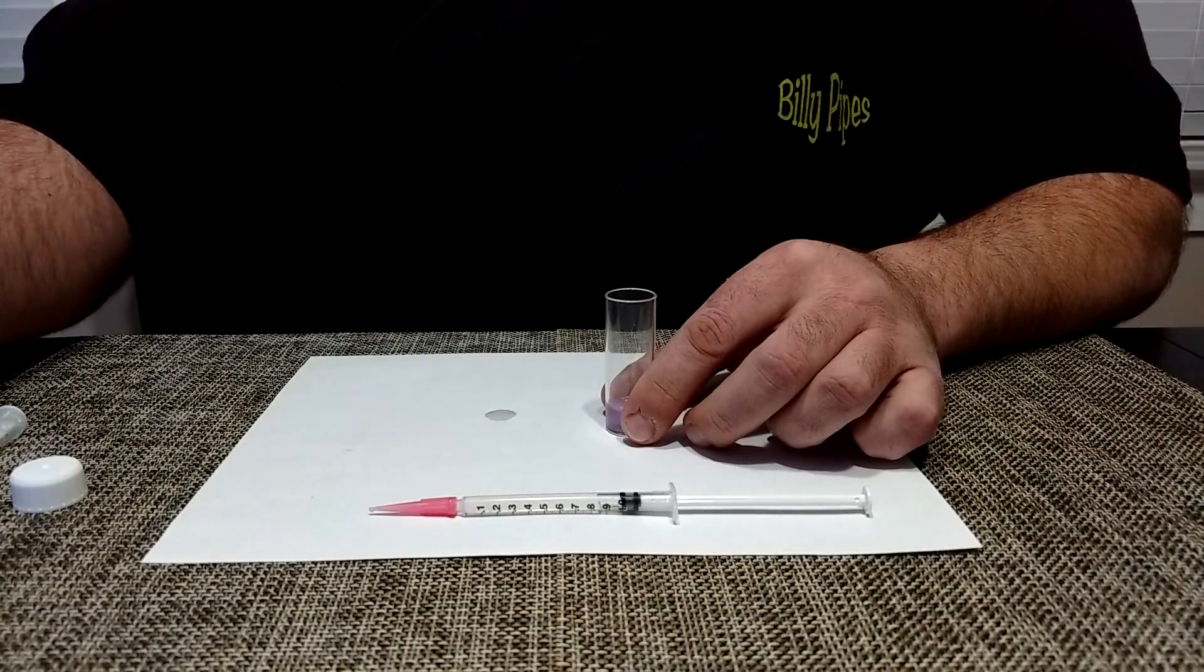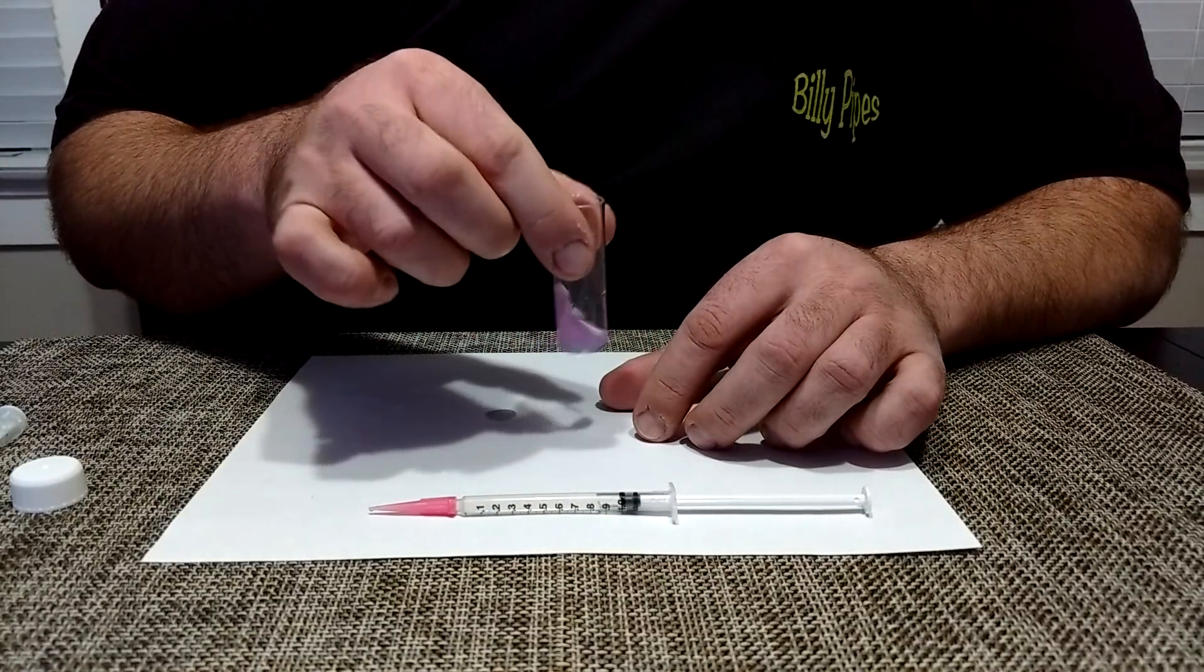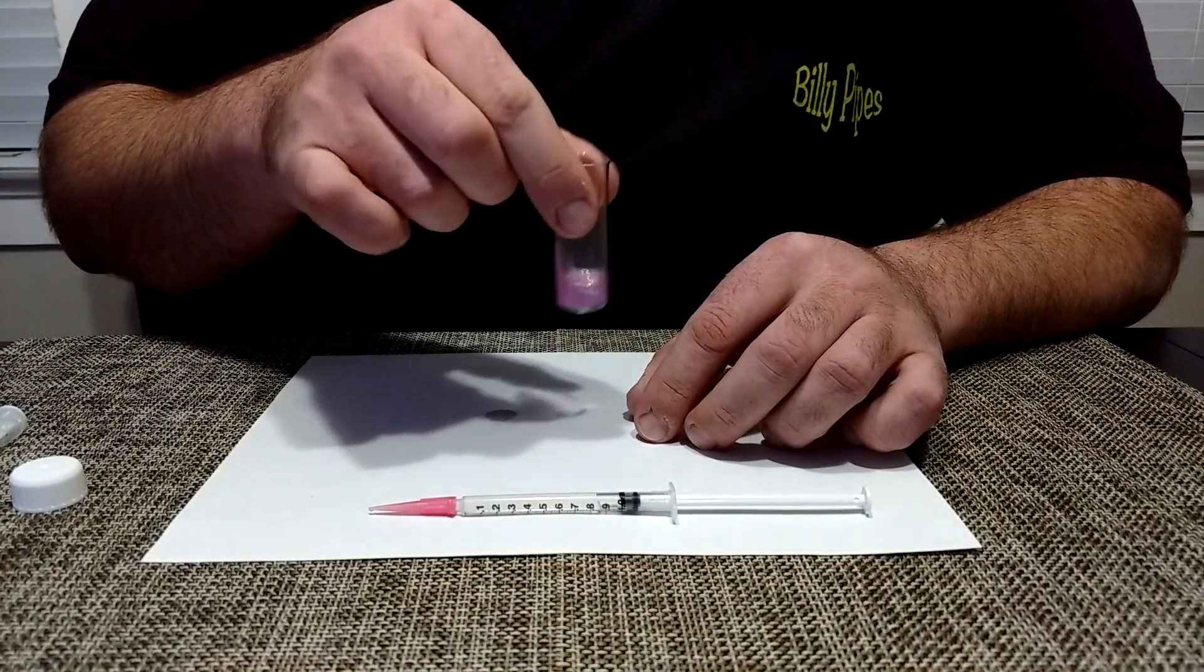And then you can go ahead and shake it. It says shake it for 10 seconds.